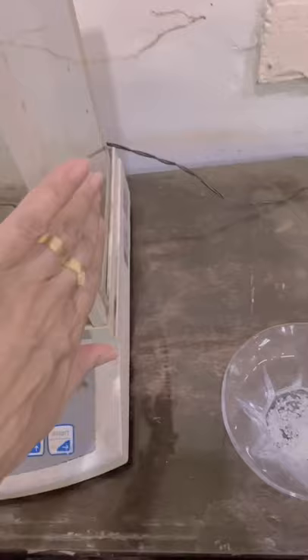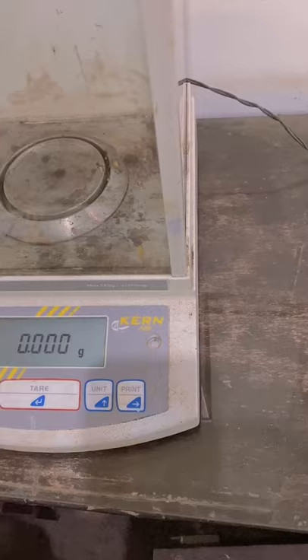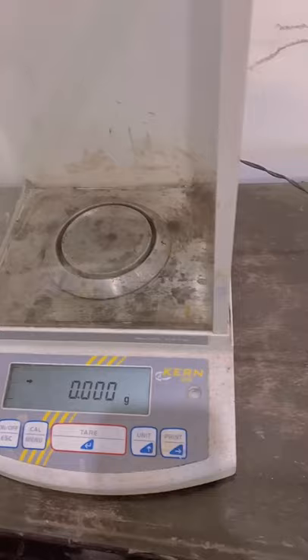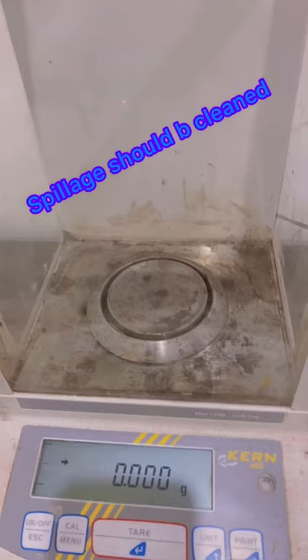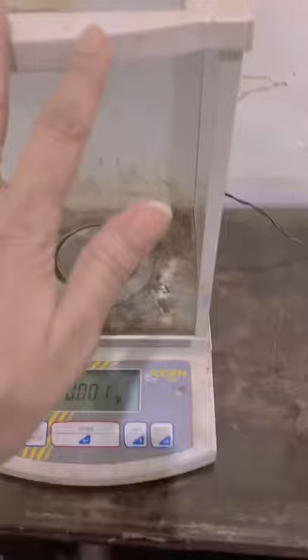After measurements, it should be cleaned — carefully remove the pan and wipe it, or replace it. Spills can be mopped with brushes, and the glass doors should be cleaned properly inside and outside with ethanol. Always clean up the spillage immediately after using it. 80% ethanol is recommended.